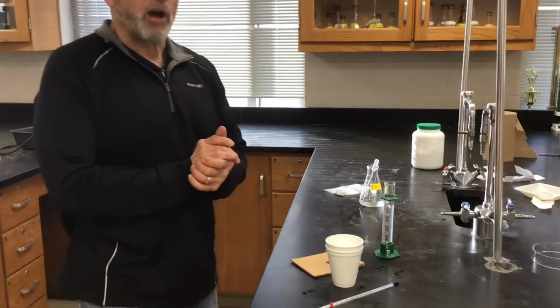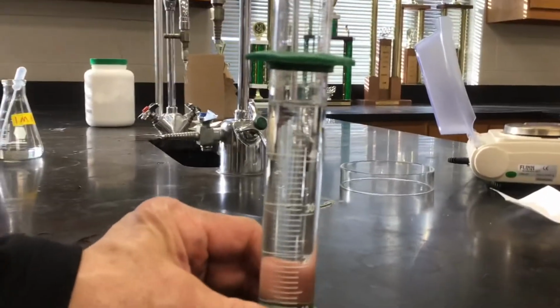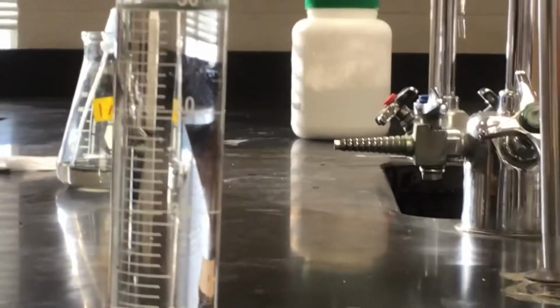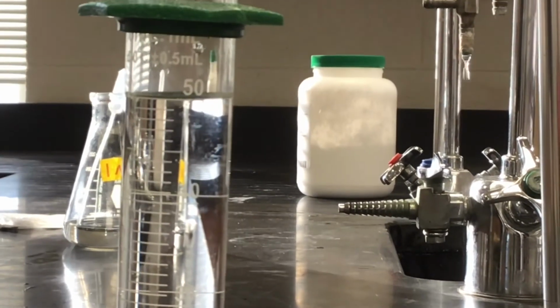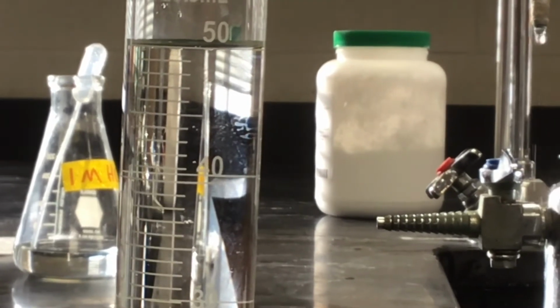So, the first reaction you recall is between hydrochloric acid and magnesium metal. And so we're measuring out our HCl. I'm going to set it down so Mr. Moore can focus better. It's rotated properly. Okay, that's good. Now, we do need to take note of what the graduations are. You can see the 40 down there and then the 50. So it's graduated to the whole mL. And he's got the meniscus right on the 50. So how do we read that volume? What would you say the volume is if it's graduated to the whole mL?